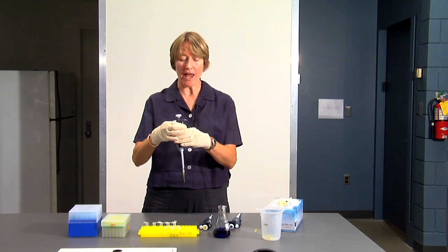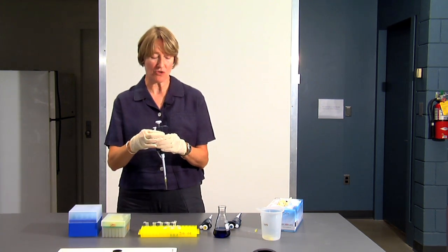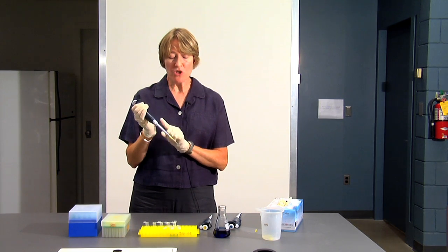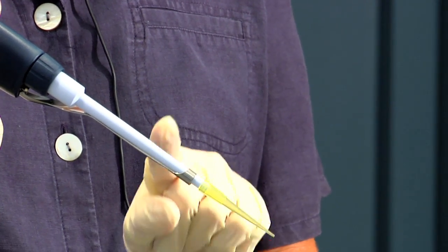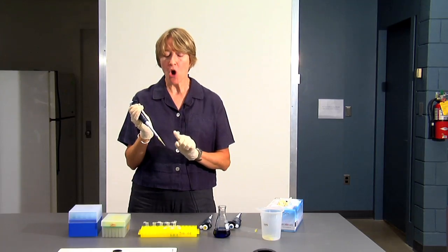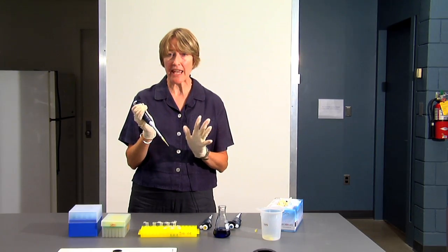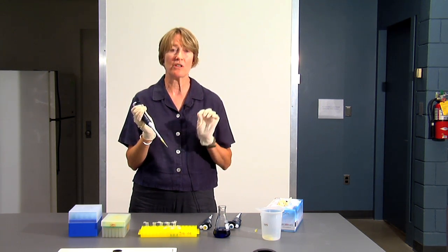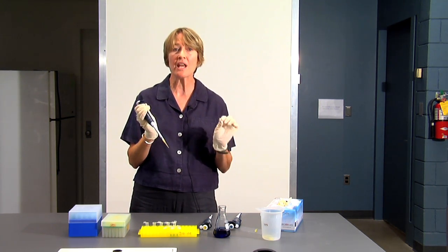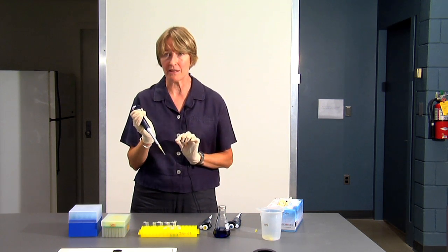One other thing to remember is you never want to touch the tip of your pipette to the table or touch it with your gloved hands or touch it to anything else except the reagents that you're using. Because again, you don't want to contaminate the environment, and you don't want the environment to contaminate your sample.